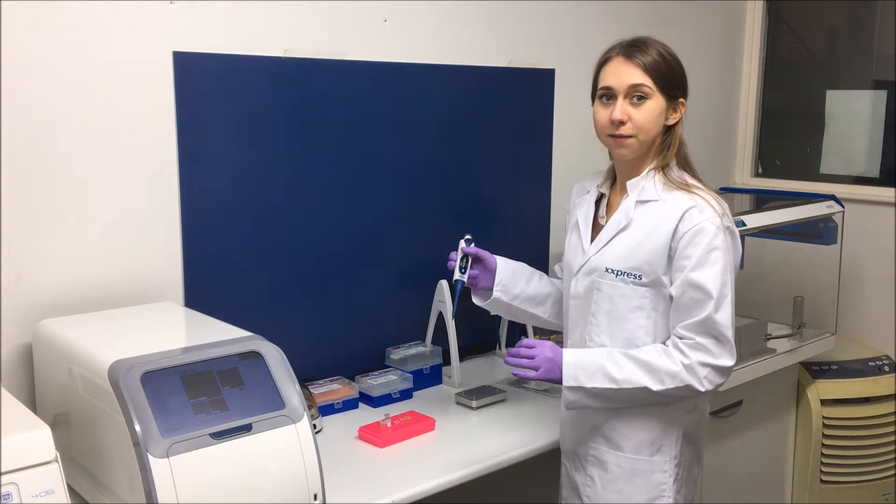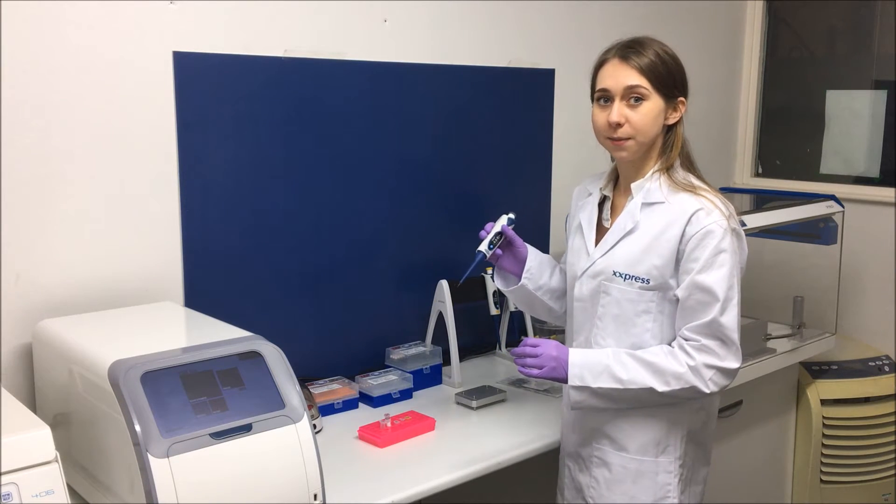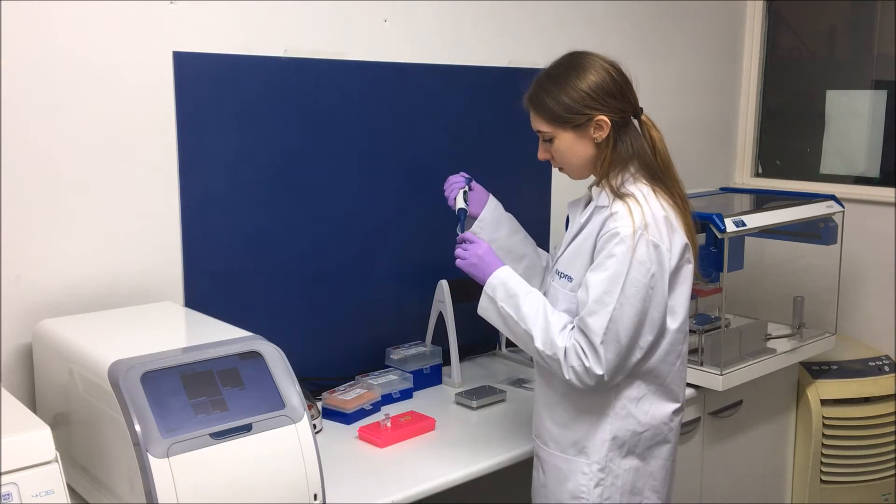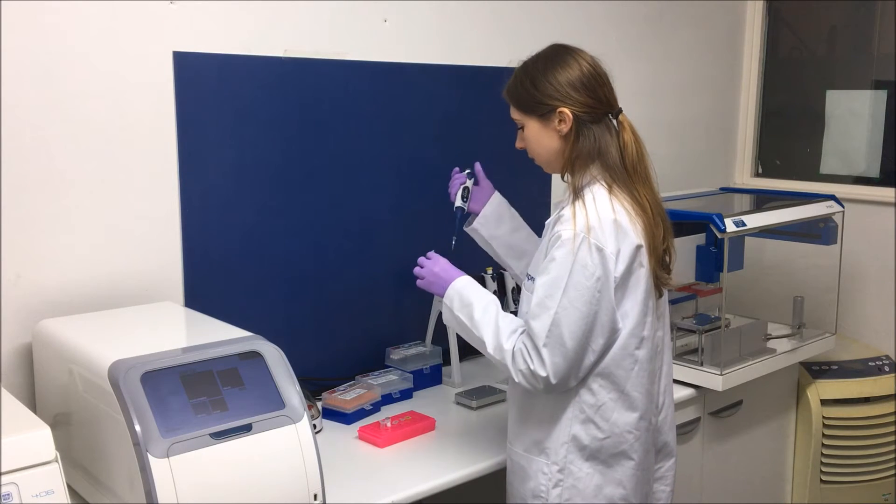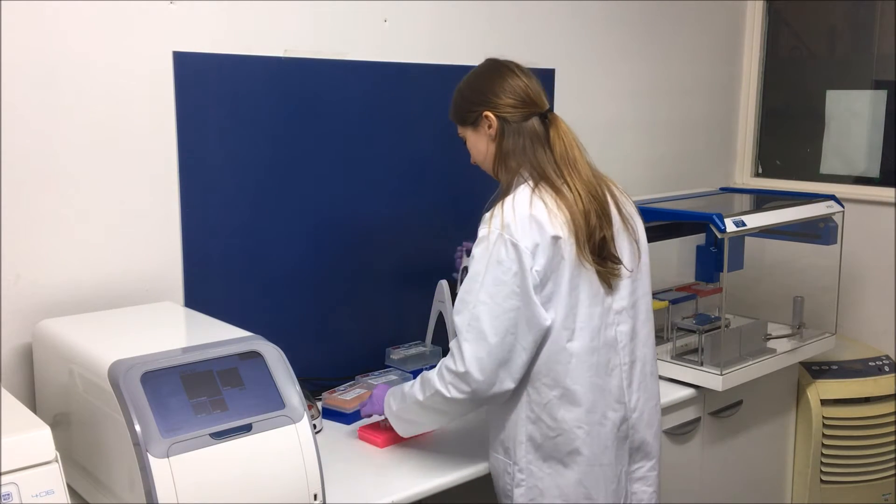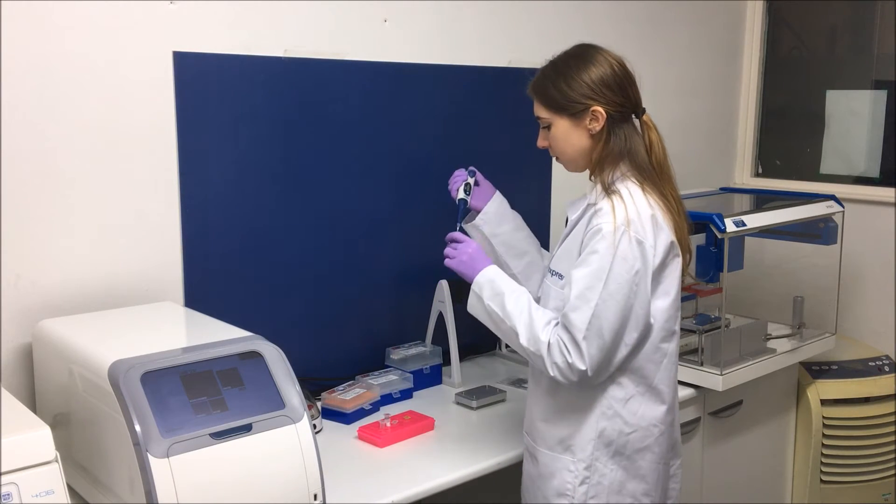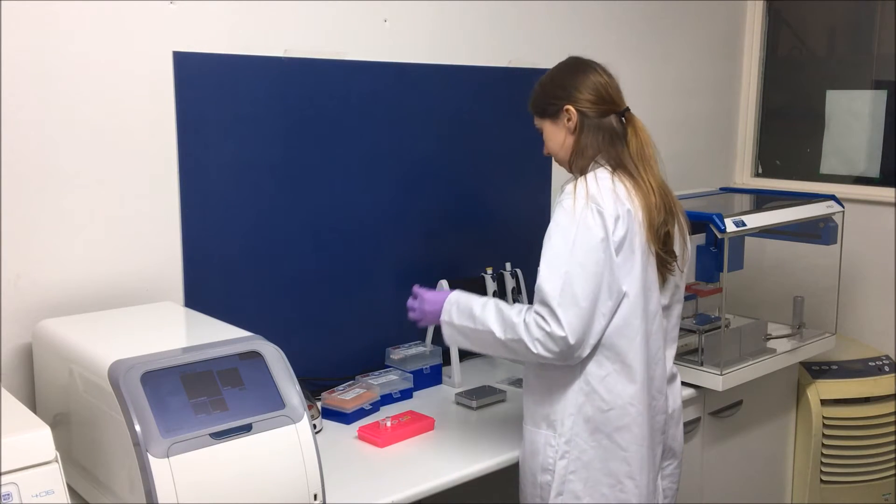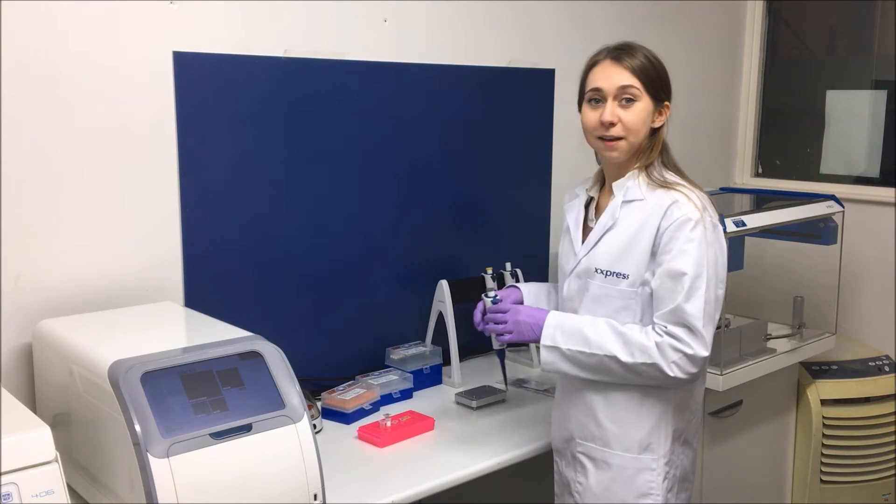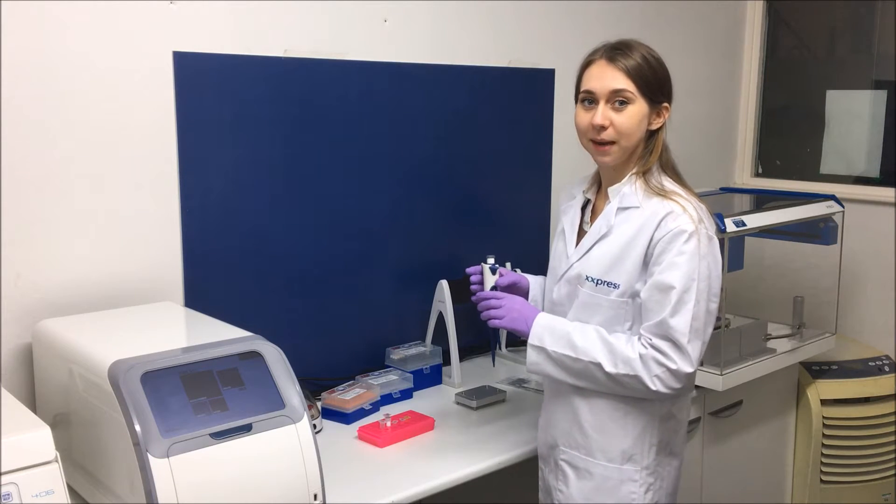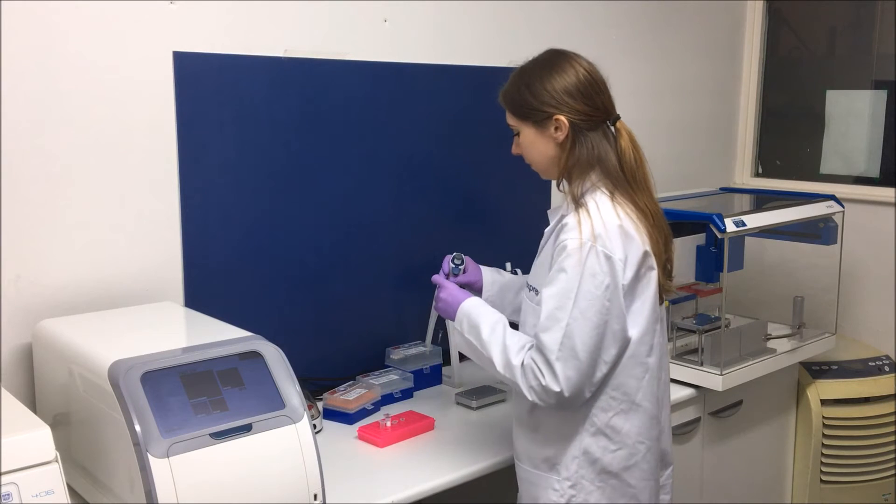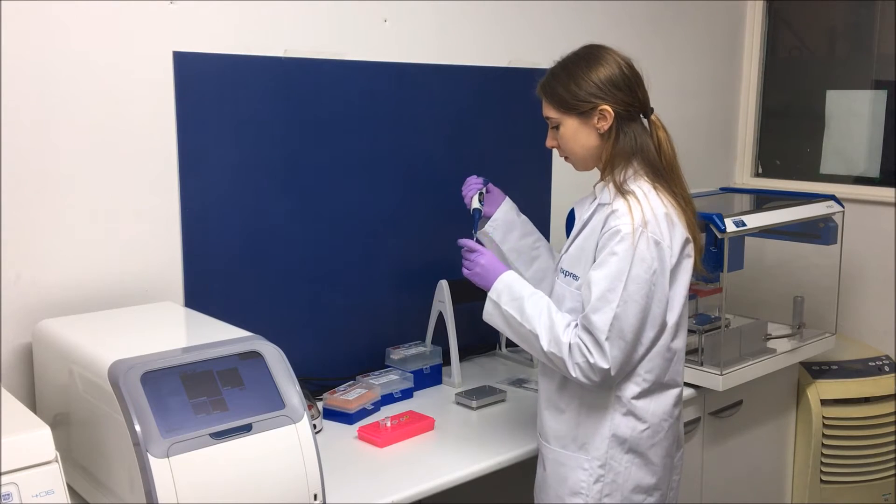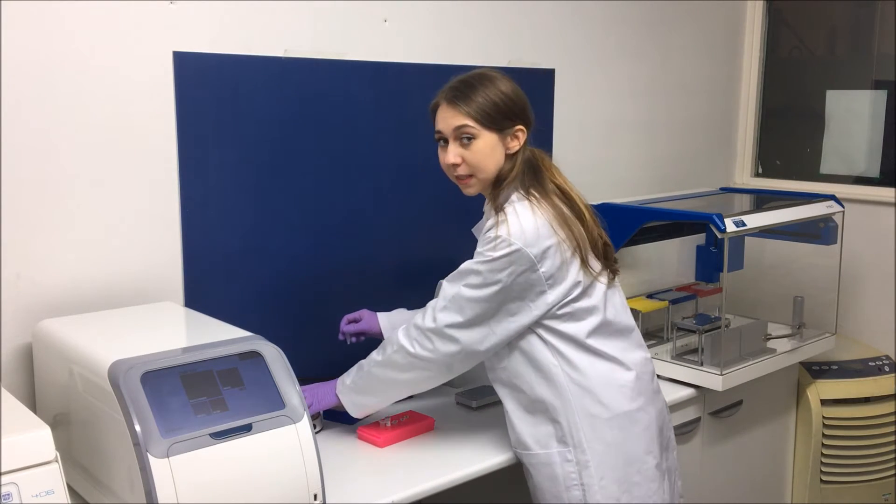I then add in 4 microliters of my forward primer and 4 microliters of reverse primer, and my human genomic DNA template. I'm going to mix all this together.